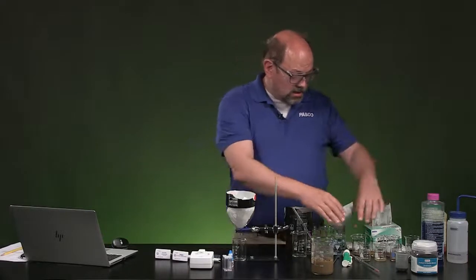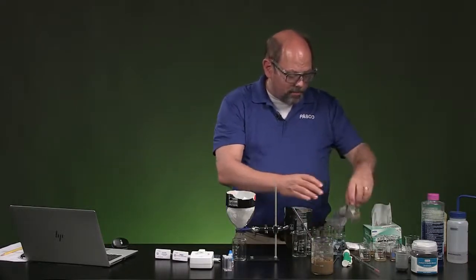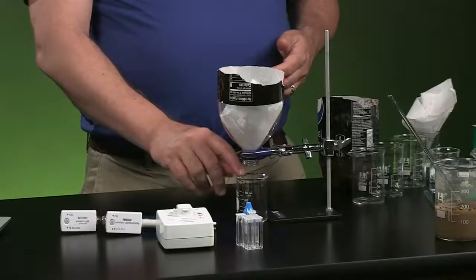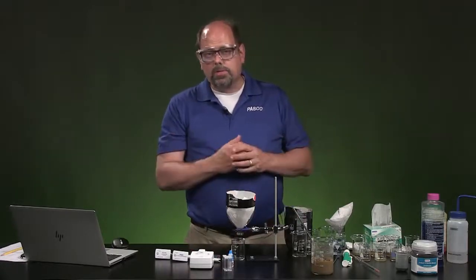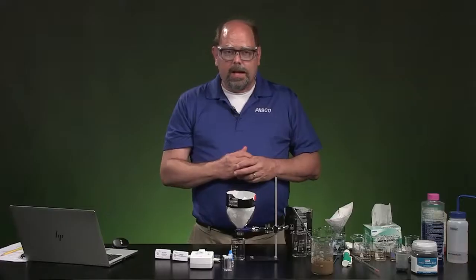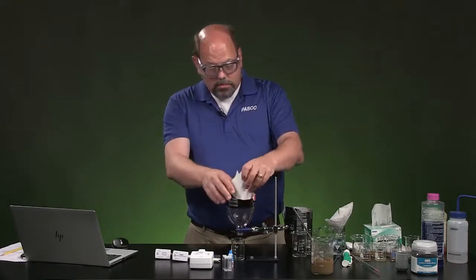Now, each of these, like I said, here's our unfiltered, untreated. We're just going to stir that back up. We're going to pour that into the filter itself and allow it to drip through to the bottom into our 4 beakers that are here for each of these methods. And you're going to see which one seems to work the best for different kinds of reasons. We'll test those shortly.